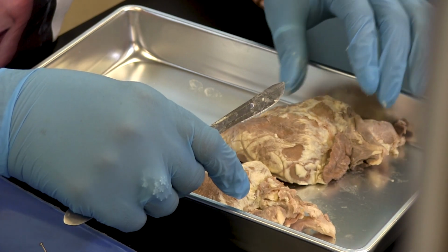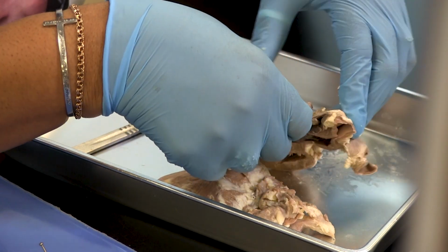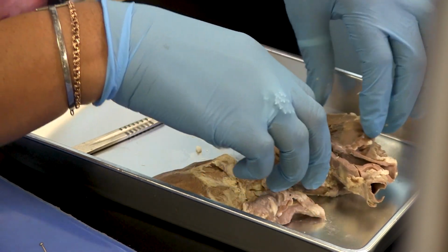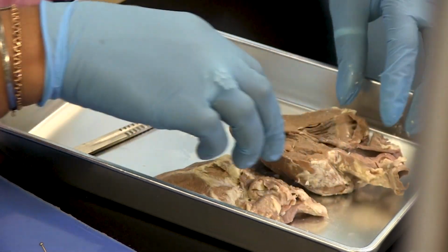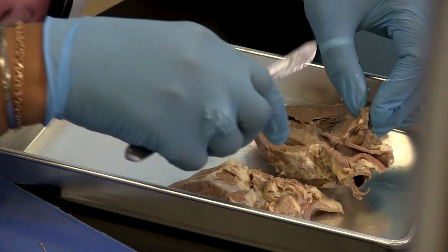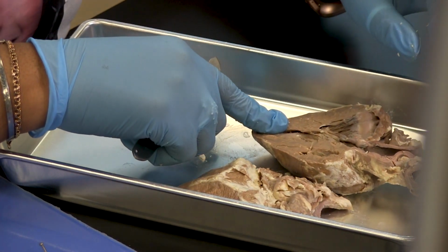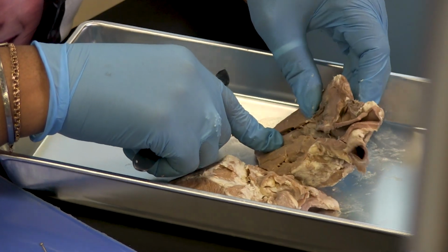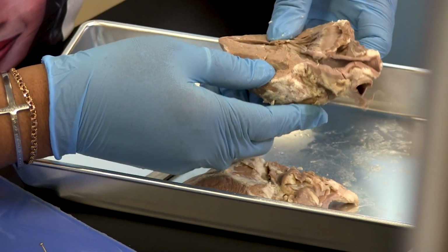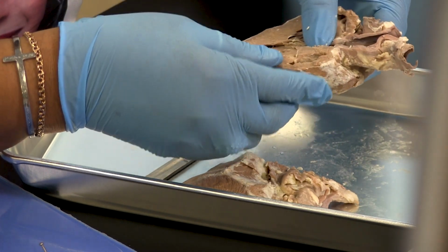The balance of the heart muscle is ventricular tissue. To identify the left ventricle, compress the ventricles on each side of the longitudinal fissures carrying the coronary blood vessels. The side that feels thicker and more solid is the left ventricle. The right ventricle feels much thinner and somewhat flabby when compressed.